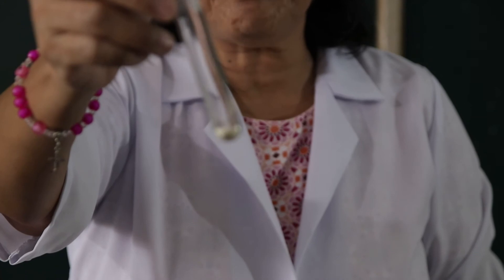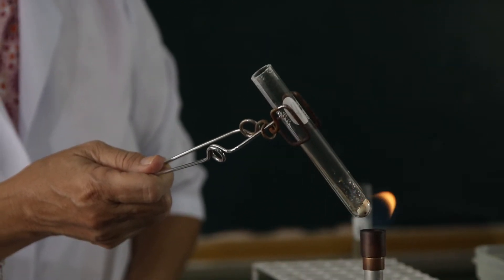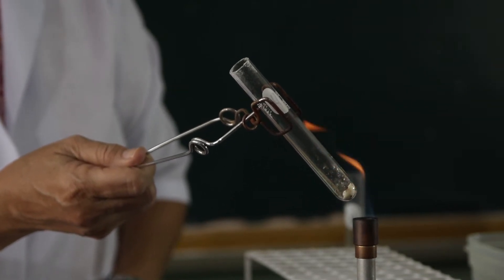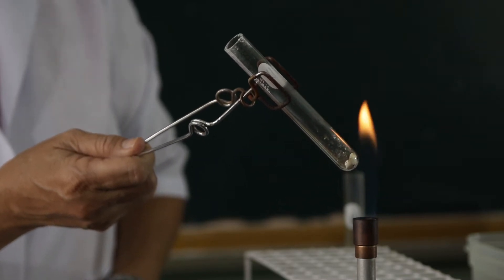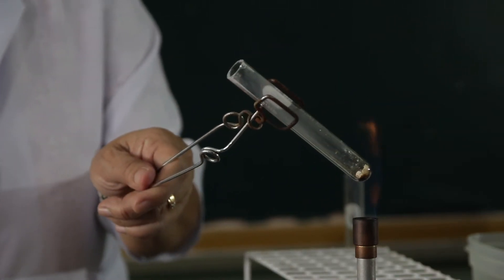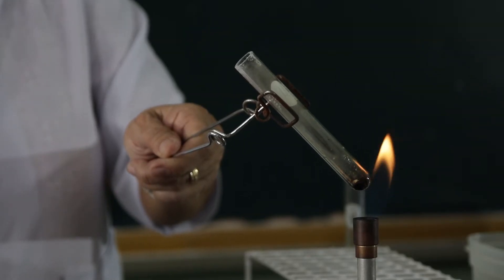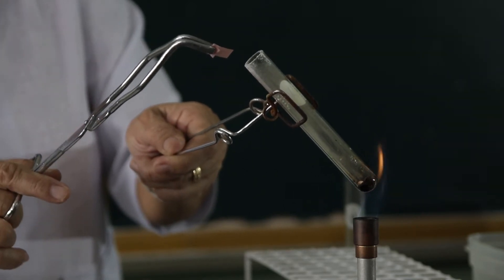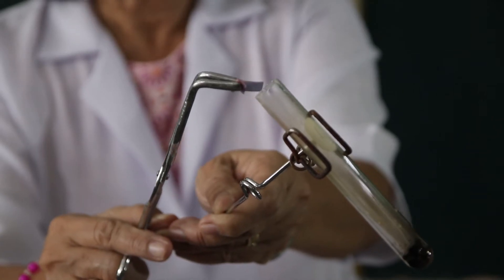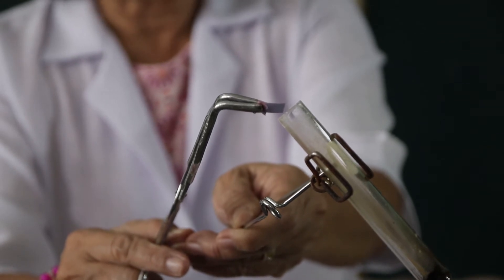Observe the mixture before it has been heated. So I am going to heat this over the flame. And once the vapor is issued out, I will expose to the vapor a wet red litmus paper and I want you to observe what happens to the color of the red litmus paper when exposed to the vapors of the mixture between egg albumin and soda lime.